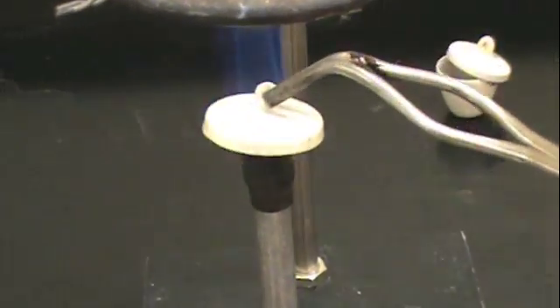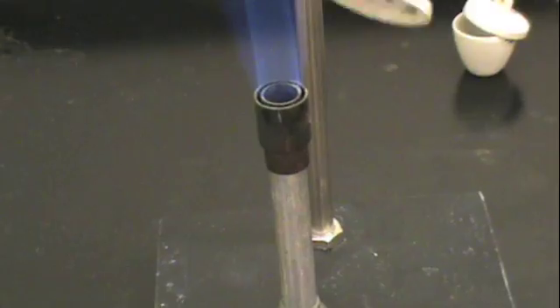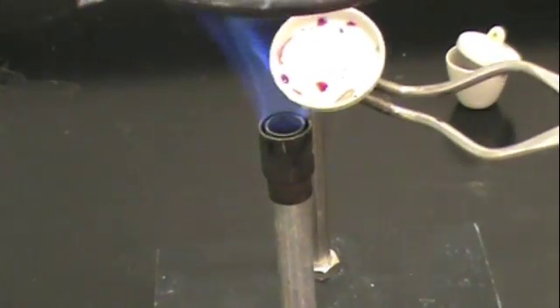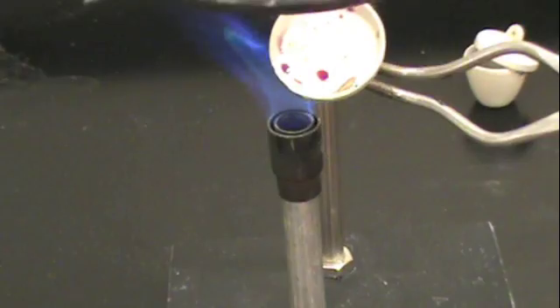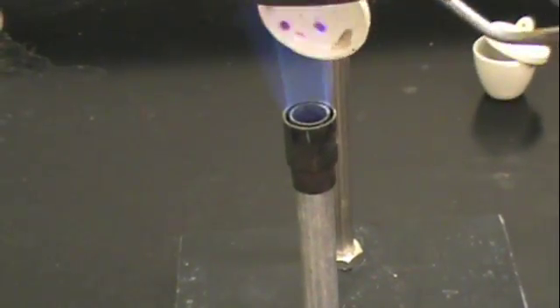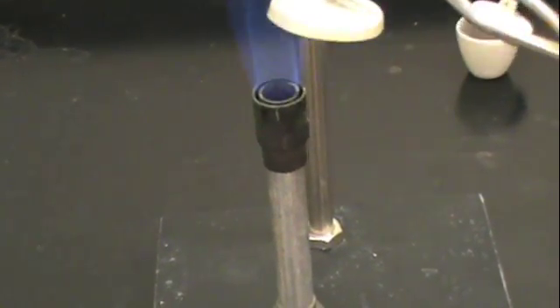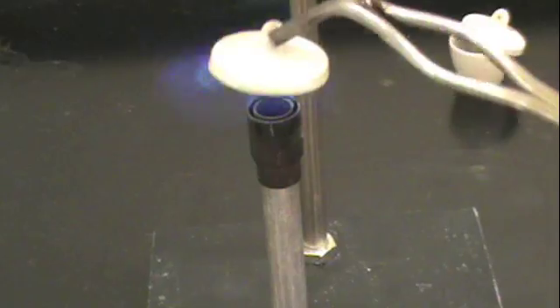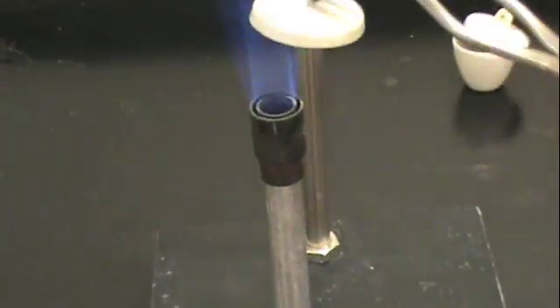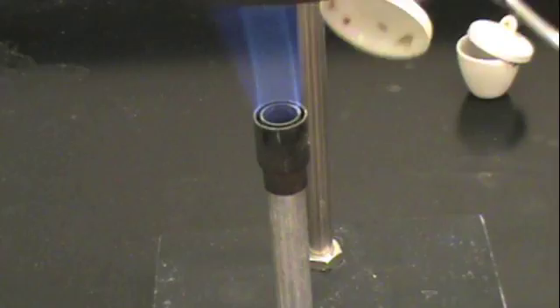The last step is to remove any sulfur that may have gotten on your crucible lid. You can hold the lid with your tongs and move it gently back and forth in a bright blue flame. Once you have removed the excess sulfur from your crucible lid, you can put it back on the crucible and weigh the entire system to obtain a mass.